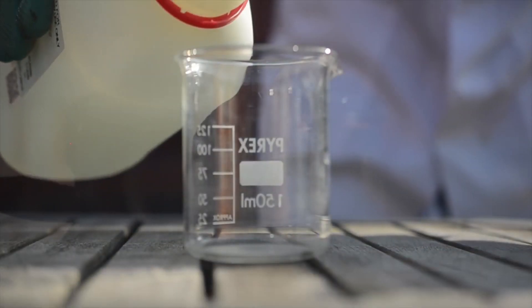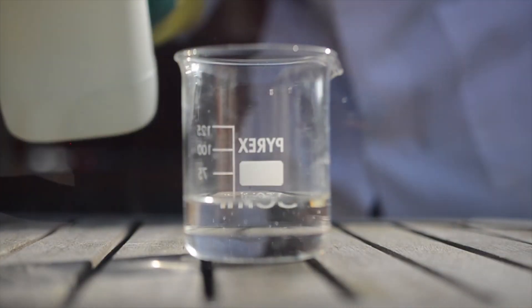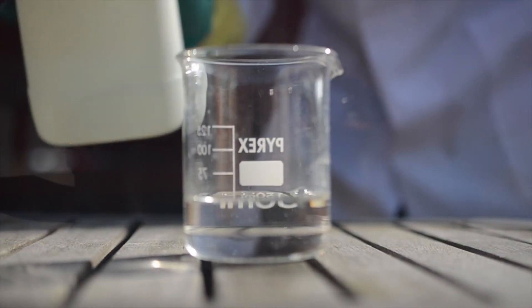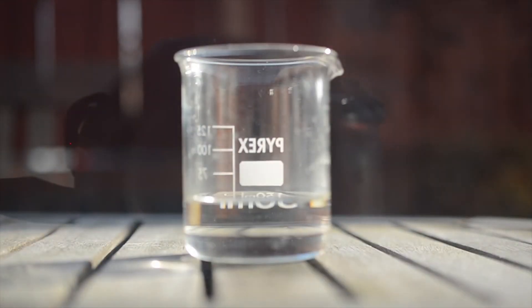In this video you will see how different metals react with nitric acid. Nitric acid is a corrosive, toxic mineral acid, a strong oxidizing agent, and the primary reagent in nitration reactions.